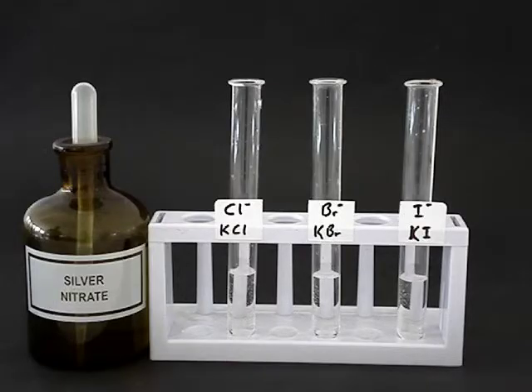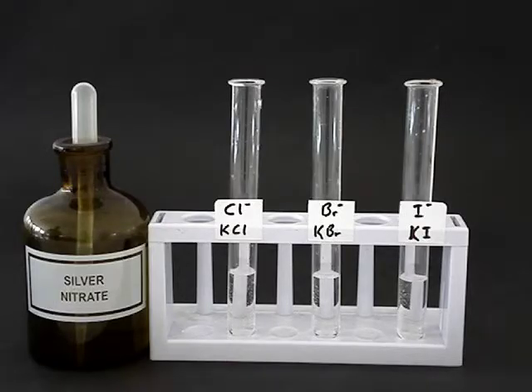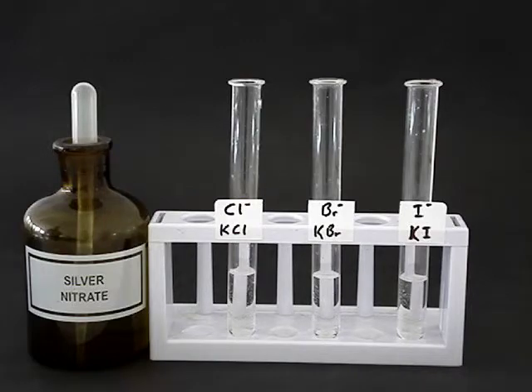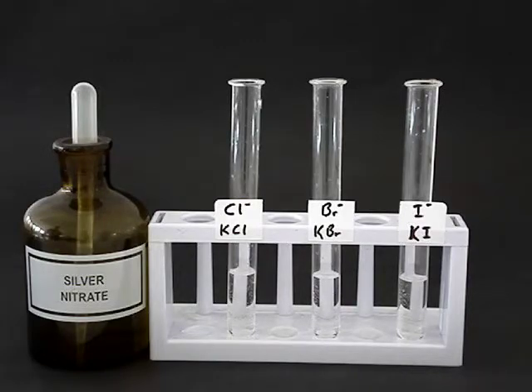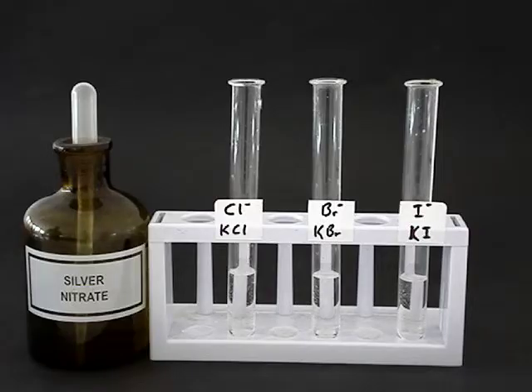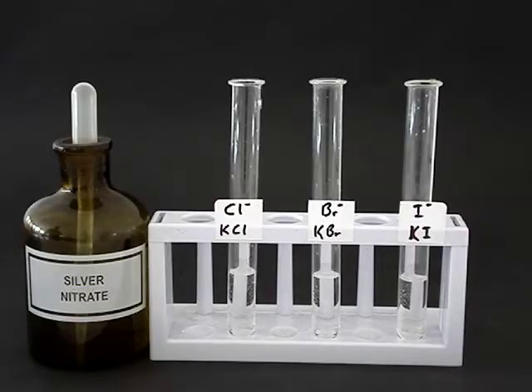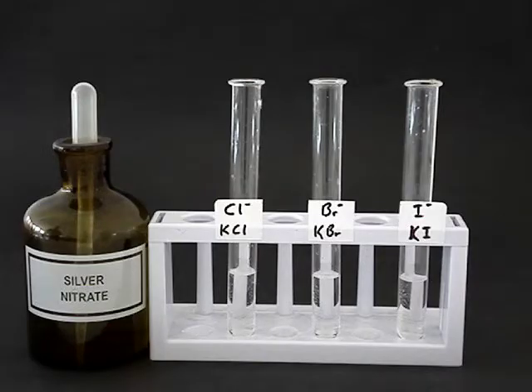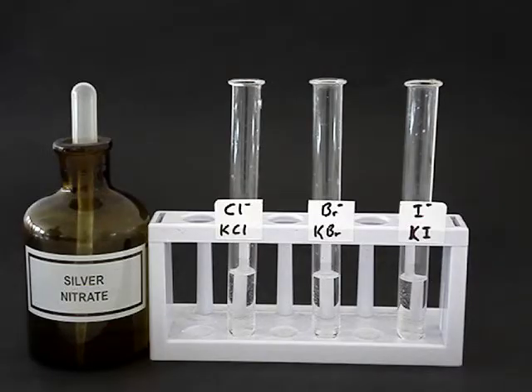We know that these test tubes contain halides. The first one contains chloride — potassium chloride — which consists of potassium K⁺ ions and Cl⁻ chloride ions, dissociated from one another with water surrounding all of the ions.